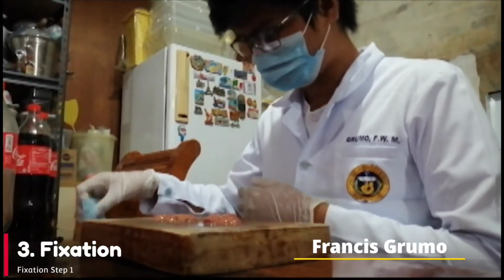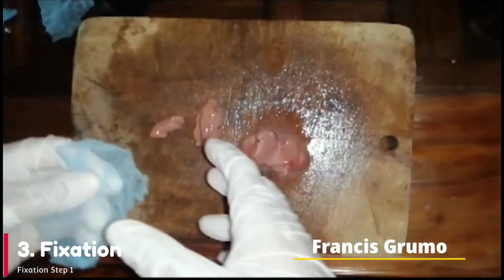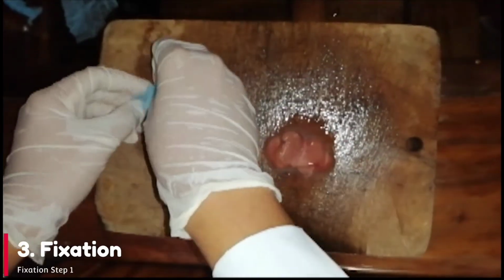After the specimen has been cut, place the samples on a tissue cassette. First sample, A1, proximal and cross-sectional cut.